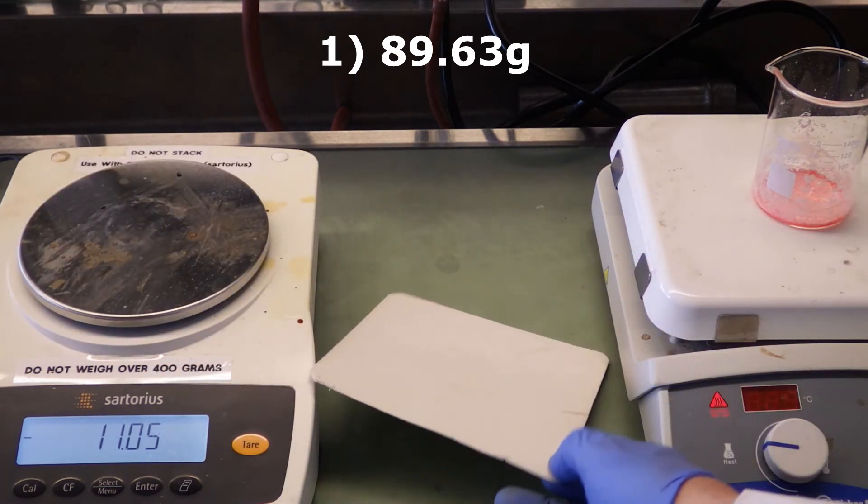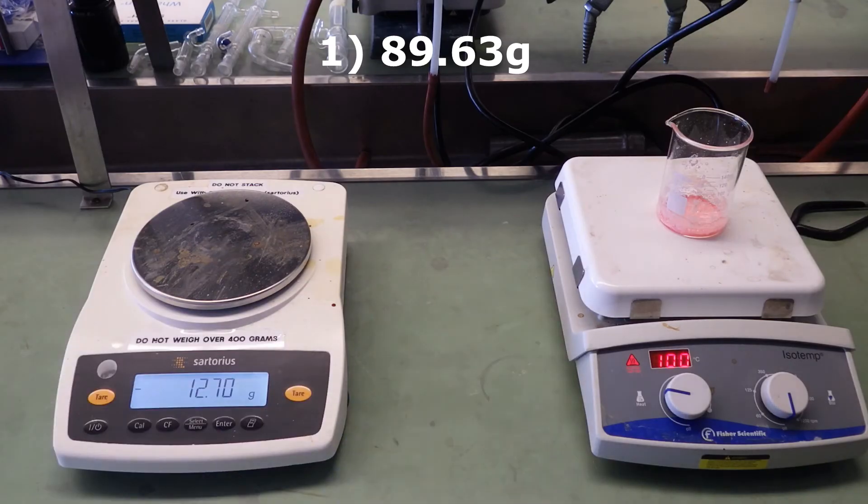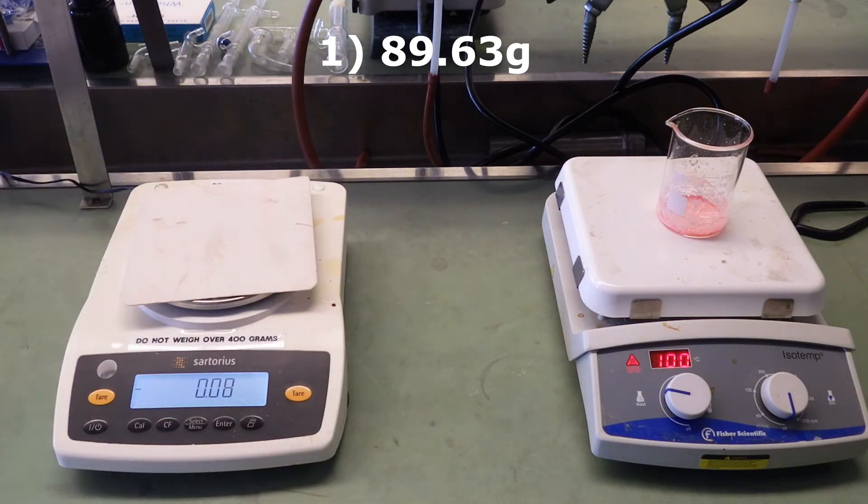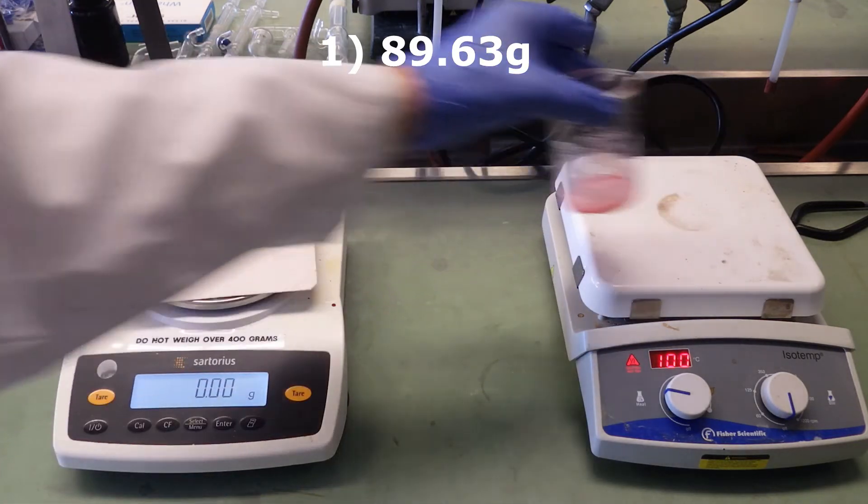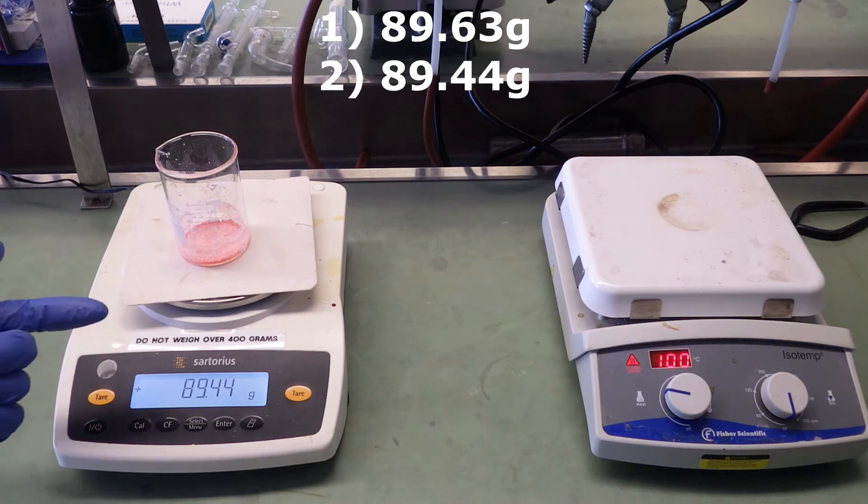We're going to heat that some more. We'll get a second mass. We need to heat this until all the water is driven off. Now we've lost a bit more. 89.44 grams.